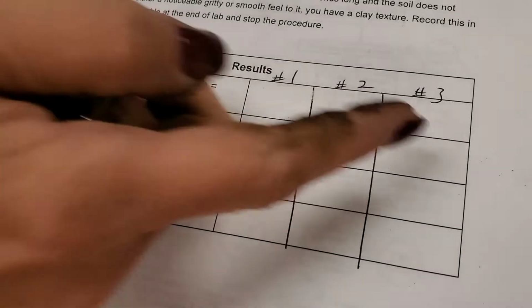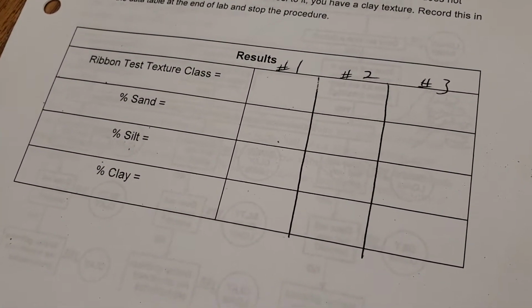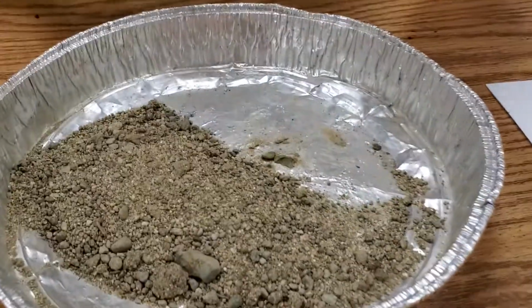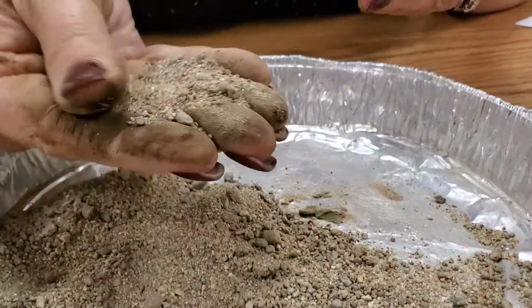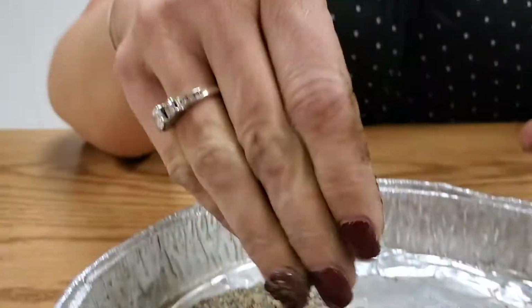So for the other two, I'm going to have you figure out the percentages yourself. We're going to walk through and determine what type of soil it is, but you're going to figure that part out for yourself. So we're going to go to soil sample number 2, take a good look at it. I'm sure you've seen types of soil like this before. Definitely very large particle size. It has that super gritty sound to it, I don't know if you can hear that.